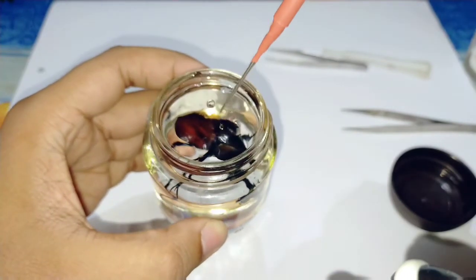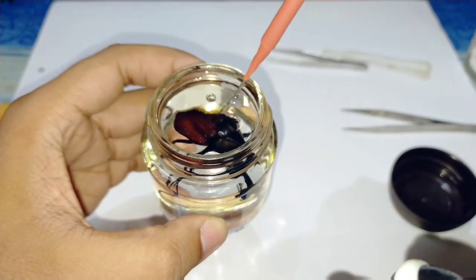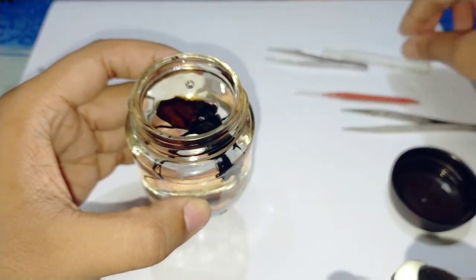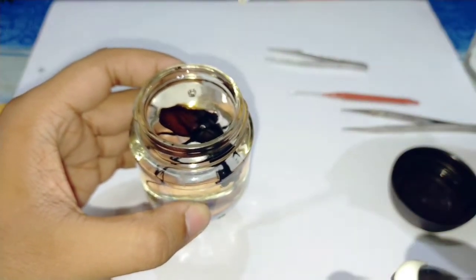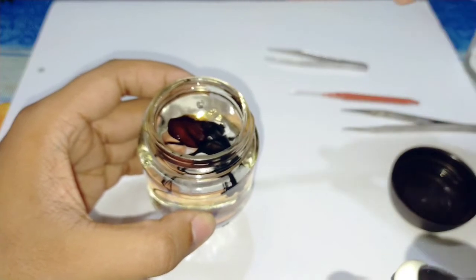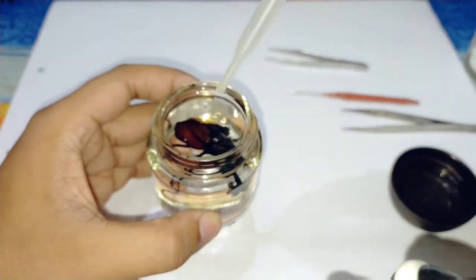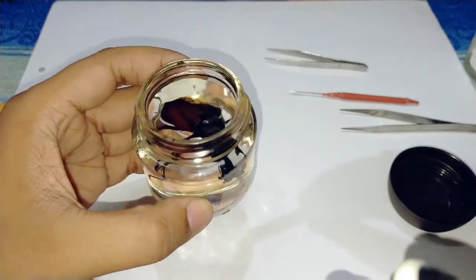You can see, small bubbles are created, not more than that. So use the dropper and remove the bubbles.